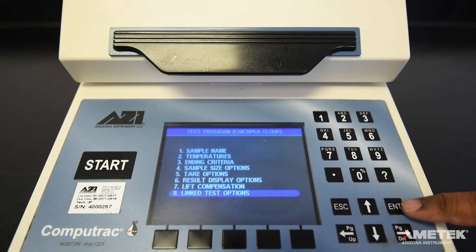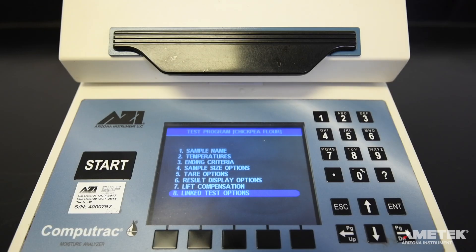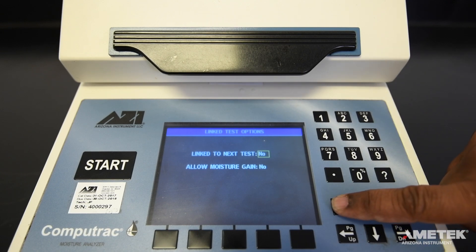The final parameter is linked test options. Since this is only available on Max 4000 XLs, Max 4000 users can skip this step. Linked test options are used when testing certain materials, such as gypsum, which contain moisture in more than one molecular state. By linking tests with different parameters, all of the moisture can be released and measured in its various forms without separate tests. Leave this set to no unless otherwise instructed. If you have a sample you would like to test using the linked test feature, contact Ametek Arizona Instrument or your local representative for assistance.